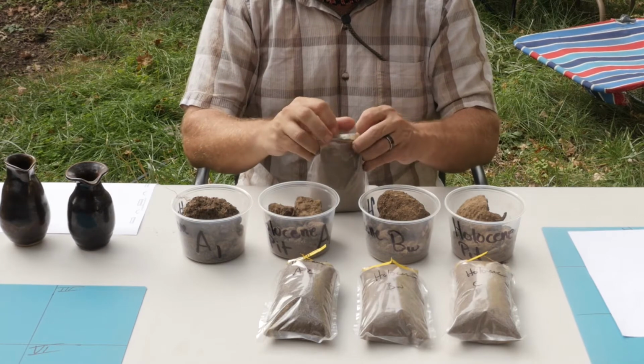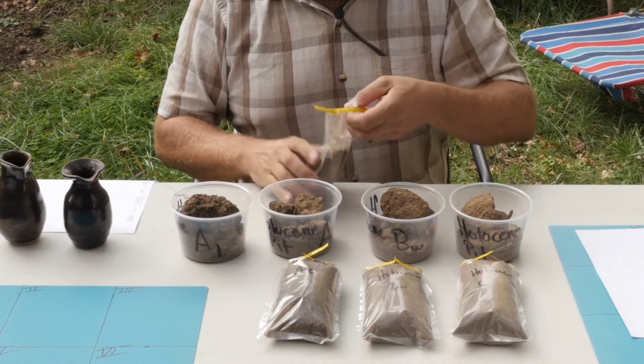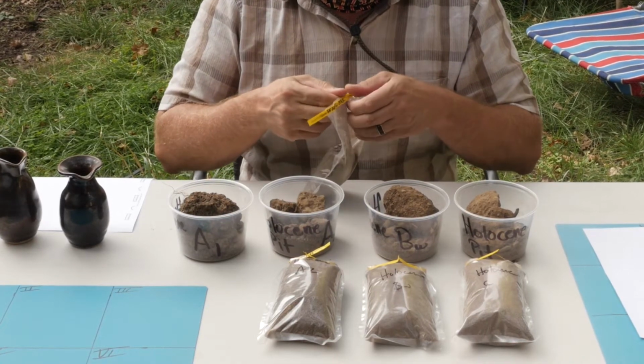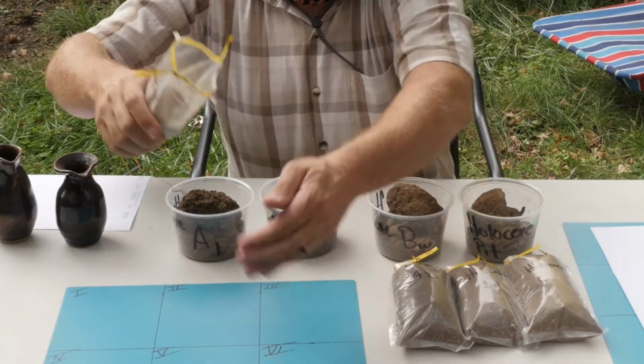So I'm just going to take some of this soil right now, and I'm going to make a mess. Normally we'd be at a pit. I'm trying to sit at this table, which is excruciating. I want to get up and walk around, which is totally fine. But I'm going to show you how to make a texture ball right now.